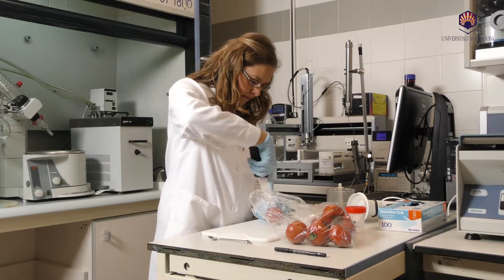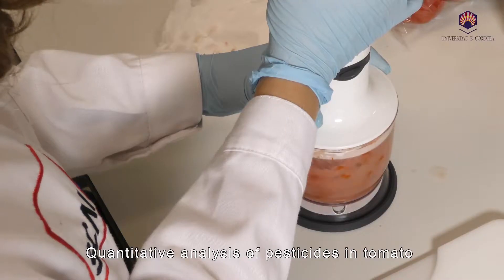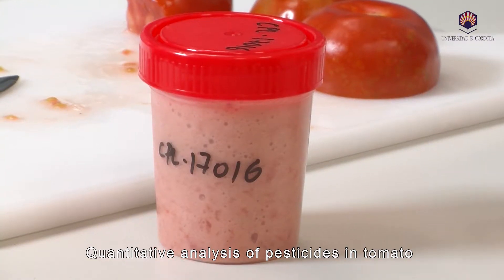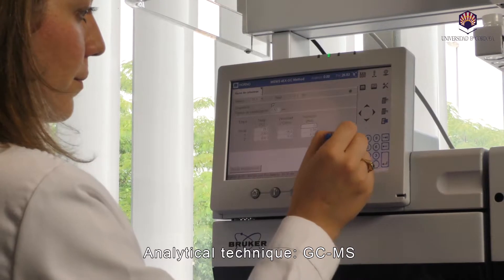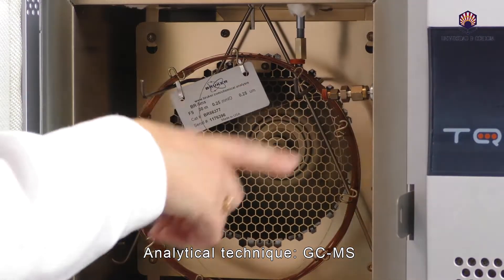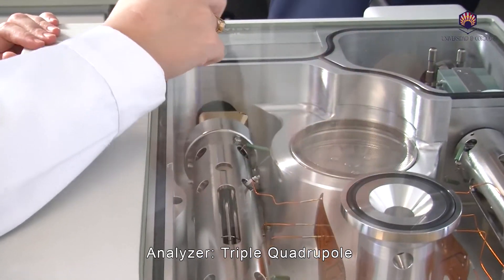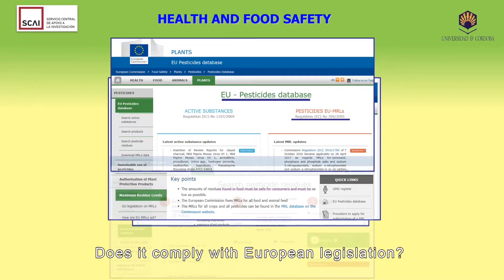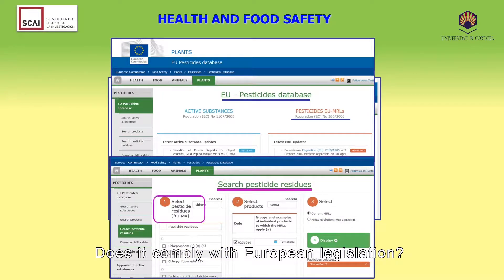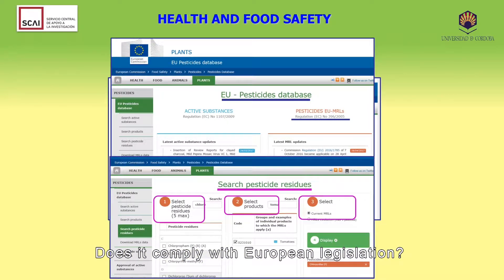We carry out a quantitative analysis of pesticides in a food of plant origin, such as tomatoes, using as analytical technique gas chromatography mass spectrometry with a triple-quadrupole analyzer. The objective of this analysis was to assess compliance with pesticide legislation.